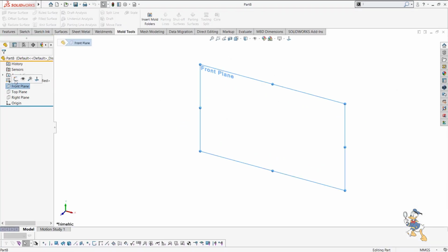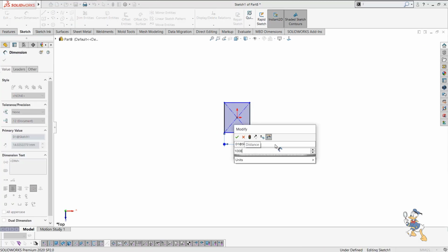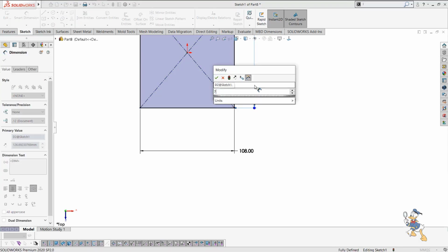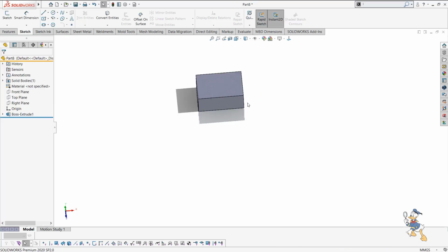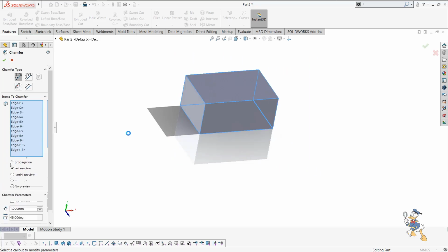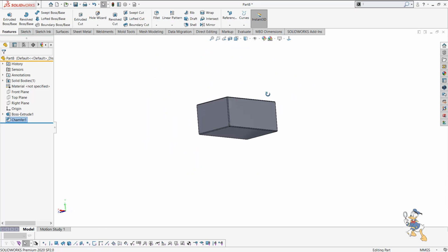and then I just need to generate a sketch, and I just need to provide dimensions to this. It will be like 108, and this would be like 72, and I need to extrude it. So I will extrude it in a mid plane with a value of 49. So it will extrude in both directions with a value of 49, and I just need to provide a chamfer. So I click on the chamfer option in SOLIDWORKS and provide the value. It will be like 1 mm to all the edges of this body. So this is how we generate a machining component.